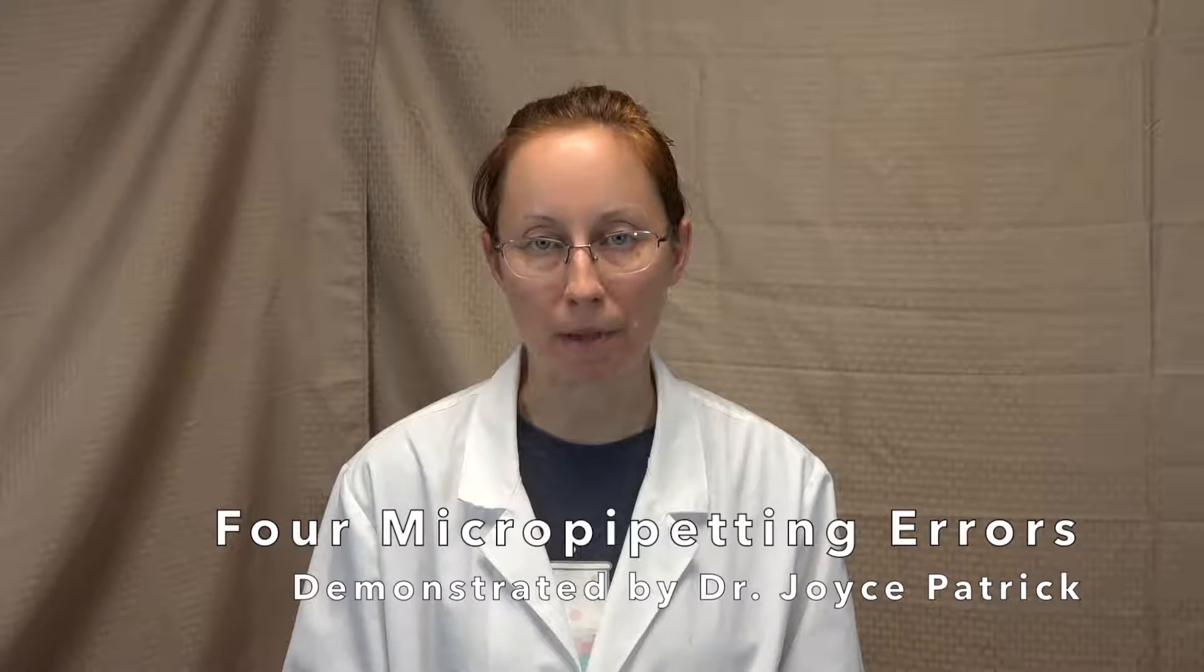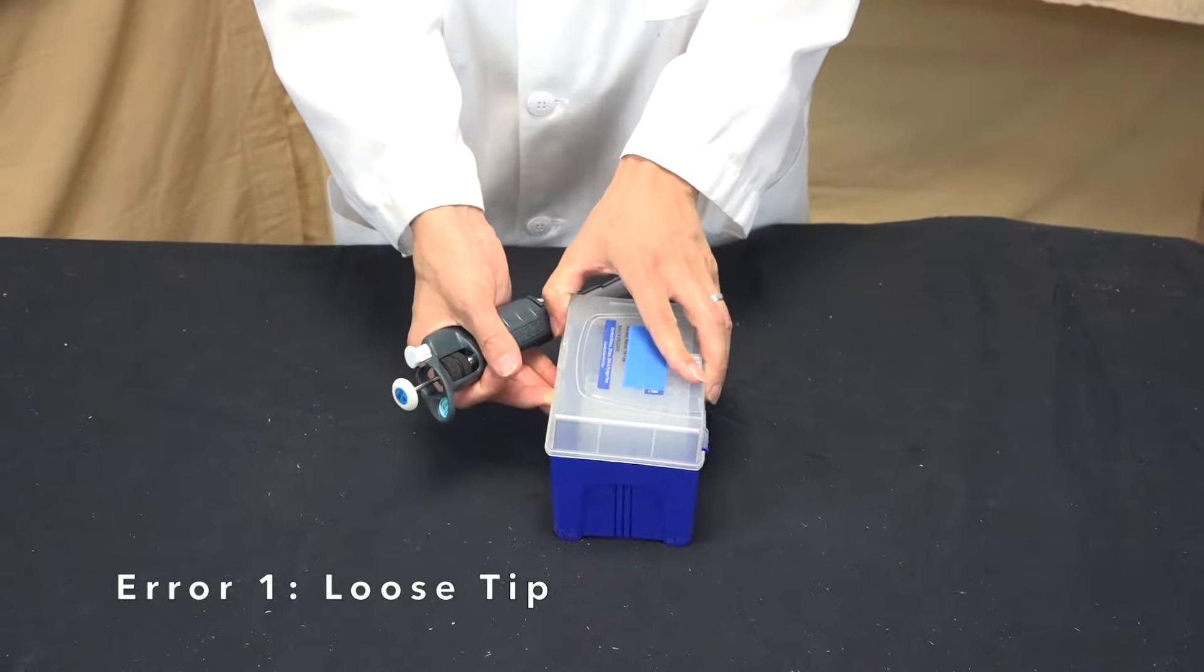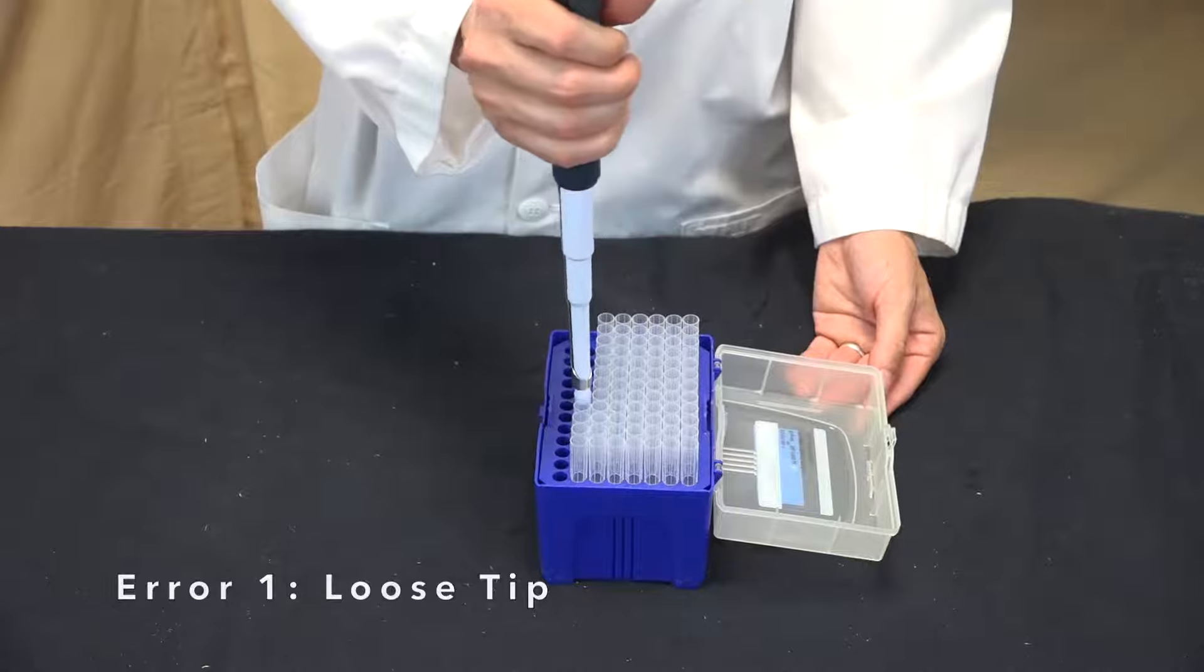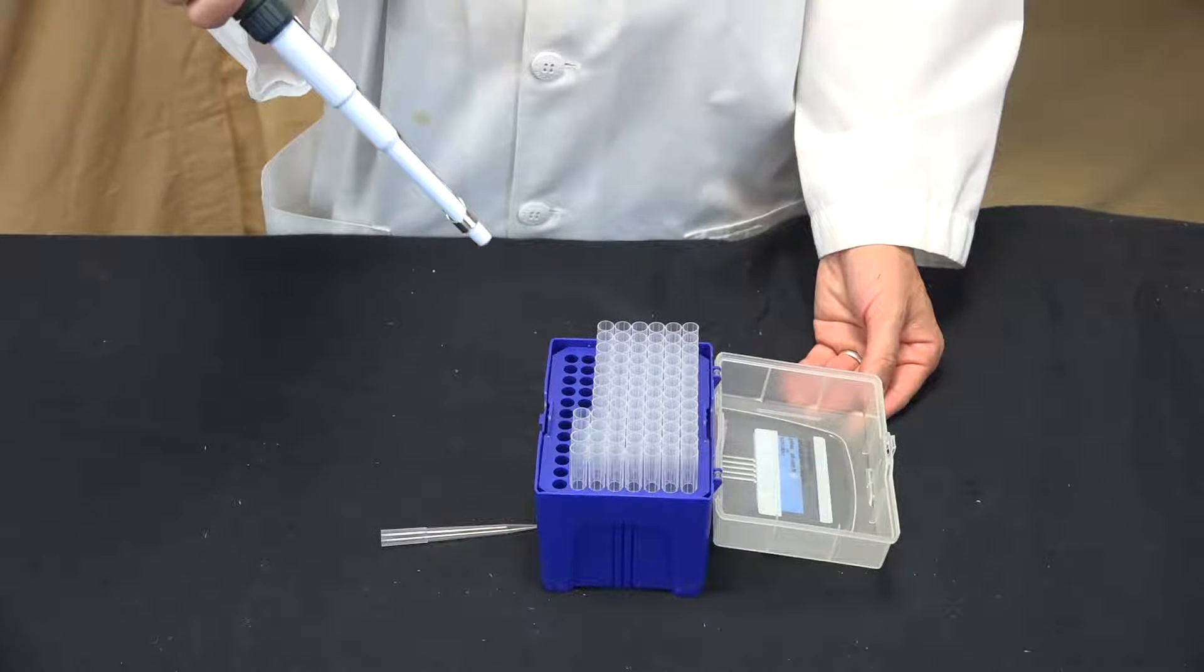Here are some things to be aware of when pipetting. The first is not putting the pipette tip on firmly enough so it easily falls off your pipetter.